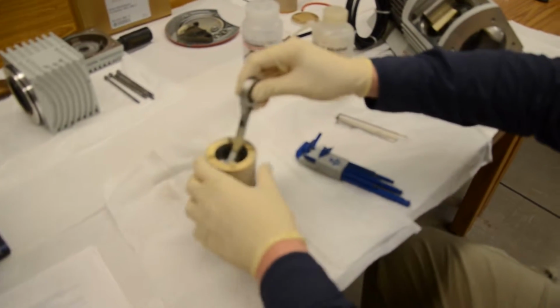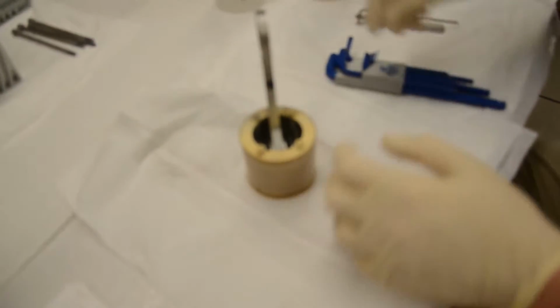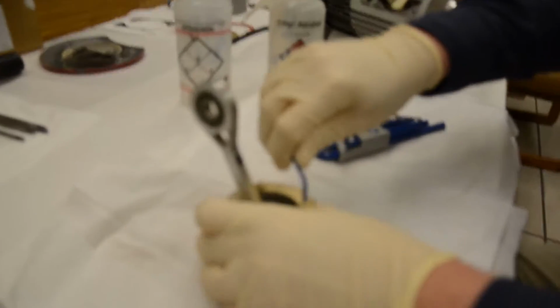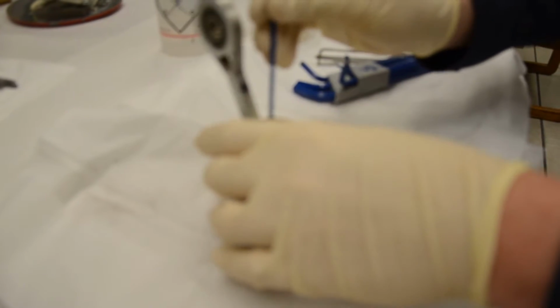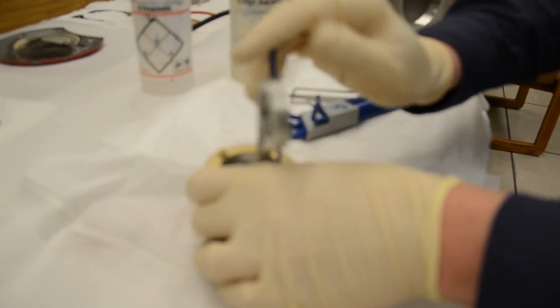Welcome back. Alright, this right here is the left piston. We're going to now take this assembly apart so we can do a full cleaning. So you can see there's a lot of Teflon dust on this. You'll definitely want to make sure that you're wearing safety glasses. Some of these pieces can fly off.